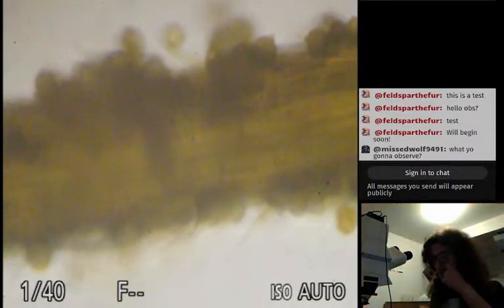This is a nice shot right here. Why is my camera leaking so much light? It's not because of that. It's just overexposed, I guess. Or it's just not liking me. Let's see. That. I'm going to zoom out to that.